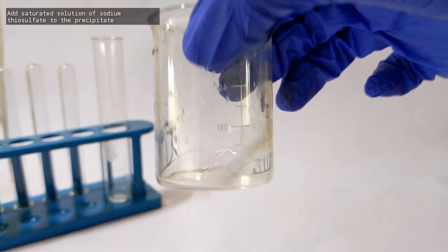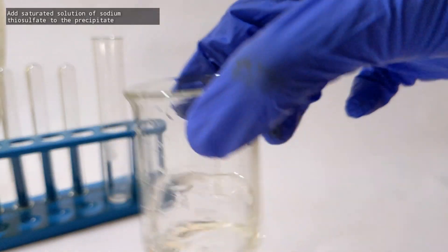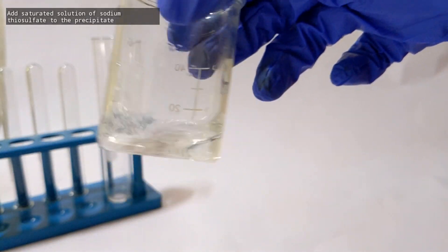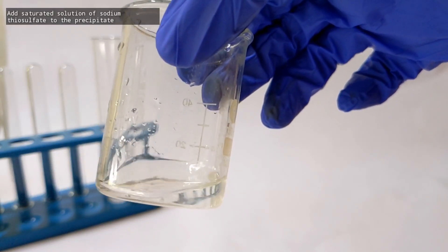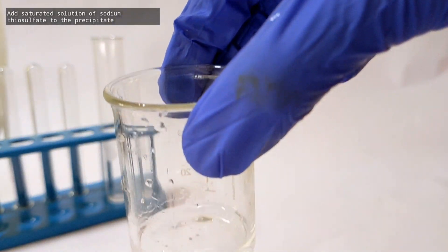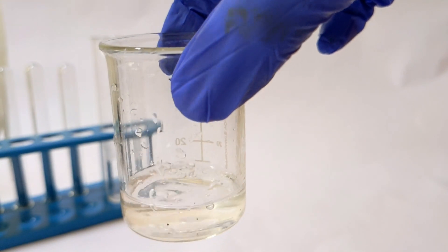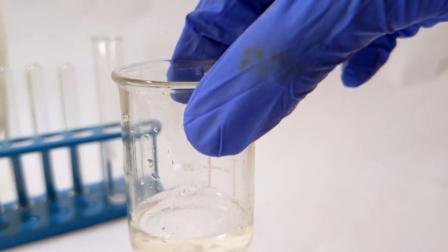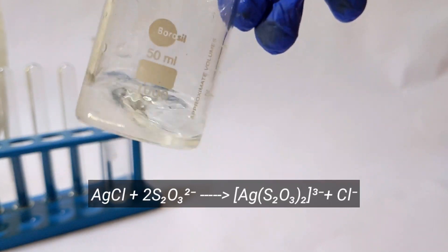The white precipitate of silver chloride was taken in a beaker and a saturated solution of sodium thiosulfate was added. The precipitate dissolves, giving a clear solution due to the formation of the complex dithiosulfato-argentate.